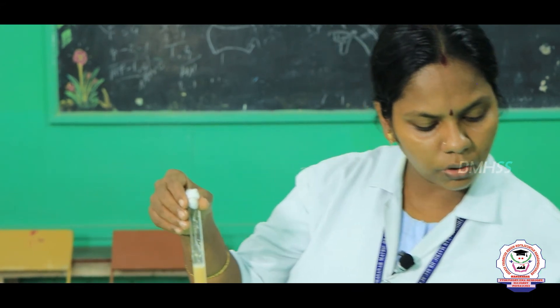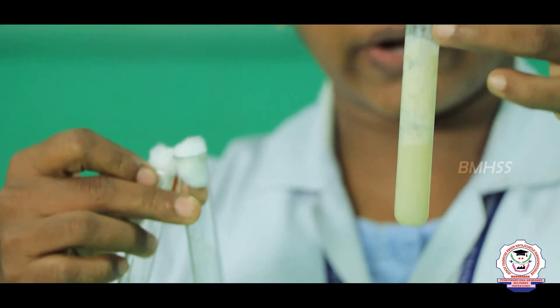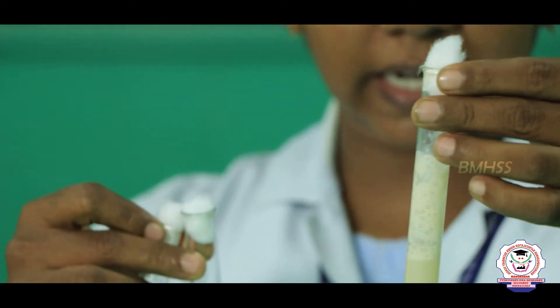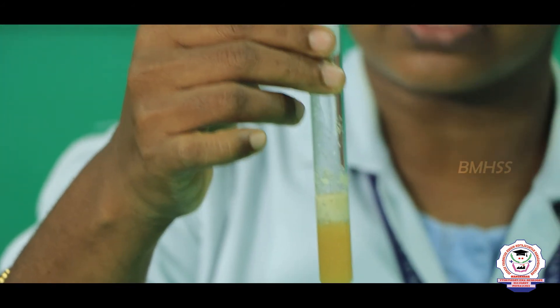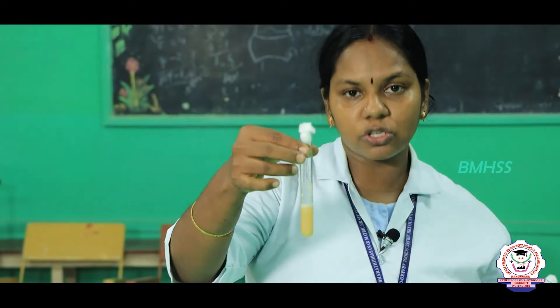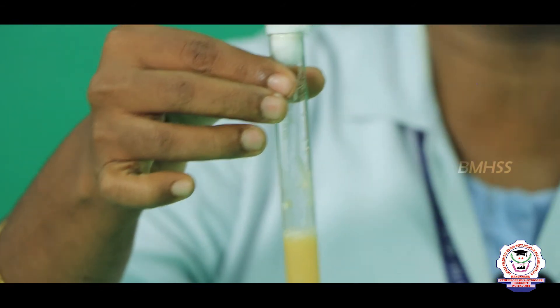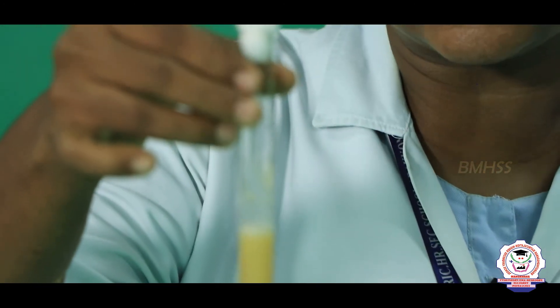In sample 3 — jaggery plus salt plus yeast — effervescence is formed but only a little, and it took more than 30 minutes, because the salt added in this solution prevents the action of zymase, making the reaction rate very slow. So: sample 1 (glucose, simple sugar) took 15 minutes; sample 2 (jaggery, complex sugar) took 20 minutes; sample 3 (jaggery and salt) took more than 30 minutes — addition of salt delayed the action of zymase.